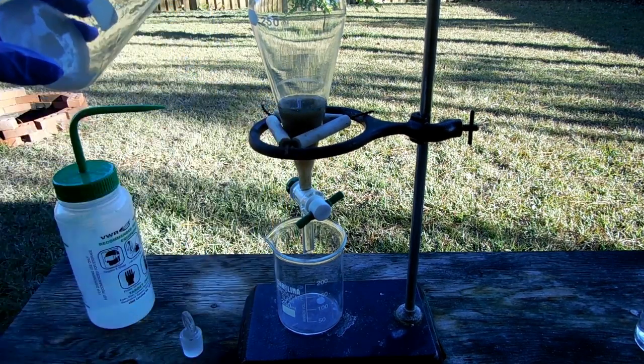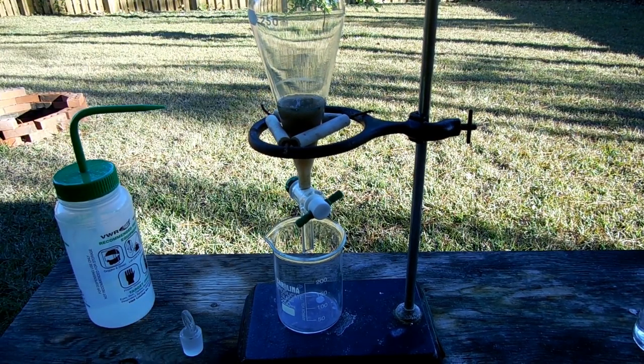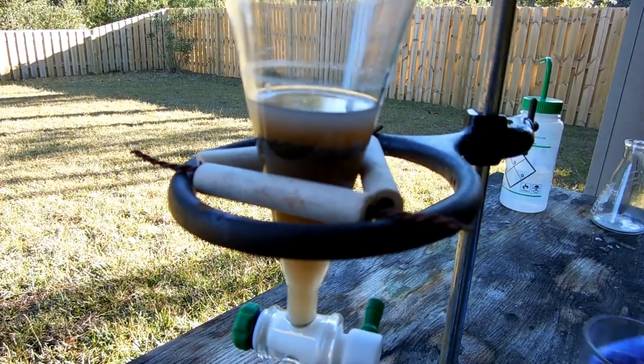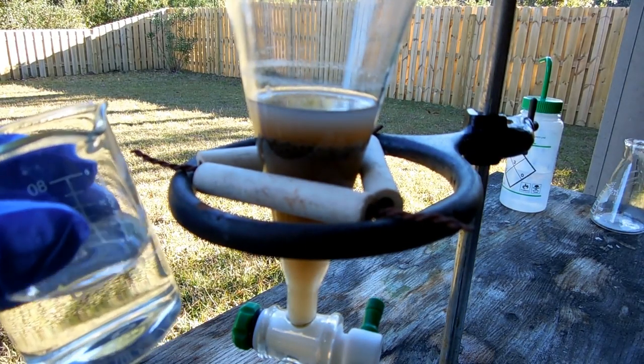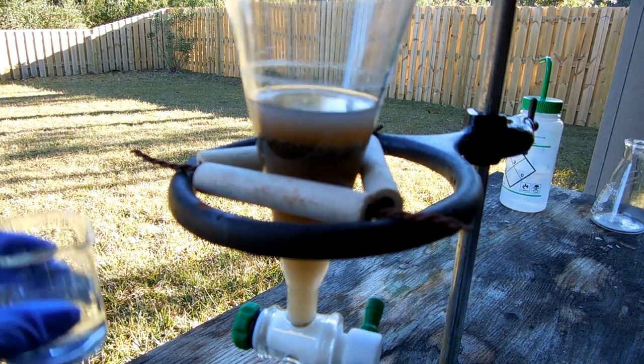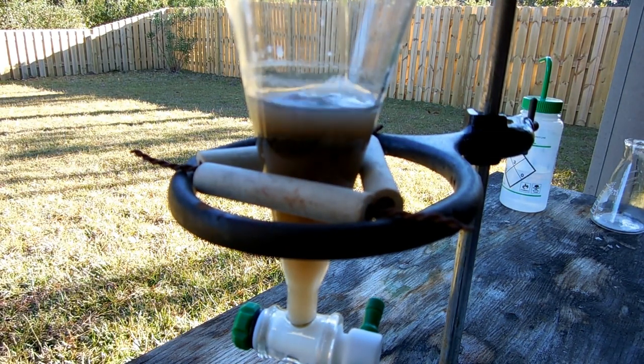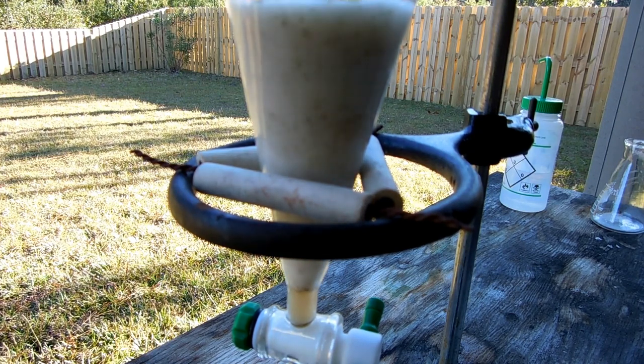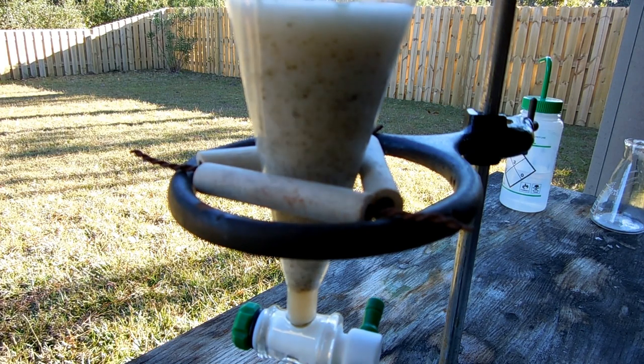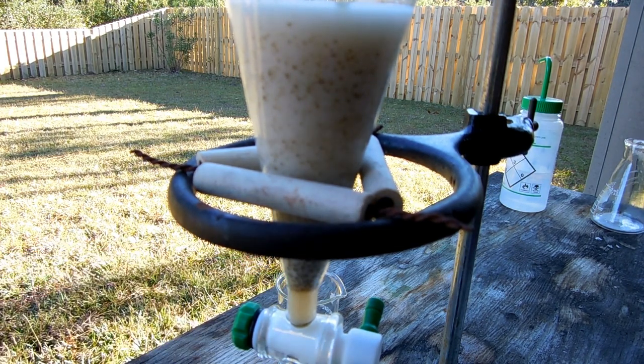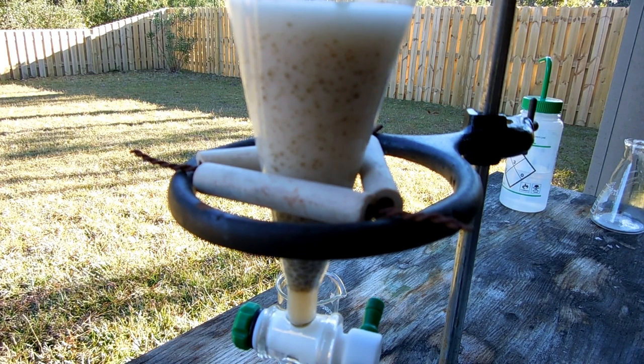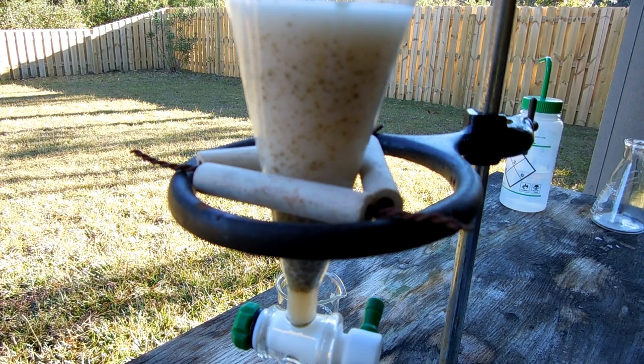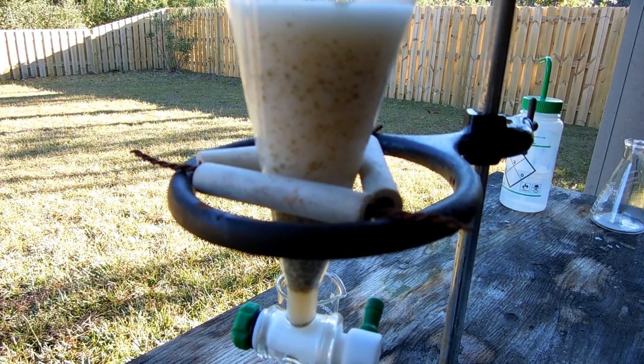That's why we have our water washes prepared. I'm washing this out with extra methanol to get all the oil out. When I add the 50 milliliters of ice cold distilled water this will separate the methyl salicylate from the methanol solution and also separate out all the water soluble impurities like sulfuric acid. To complete this we need to shake it.